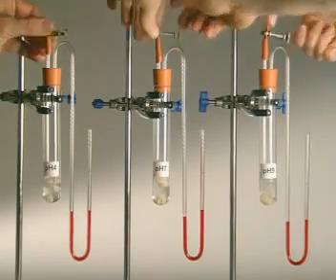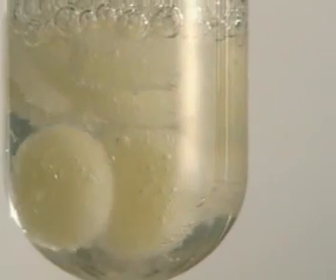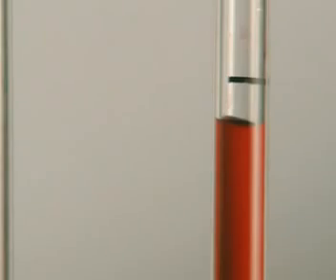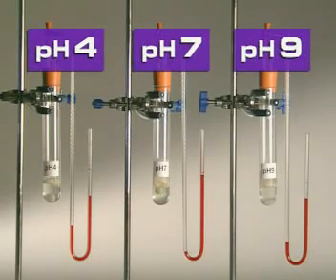The speed at which it rises is a measure of how quickly the catalase is breaking down the hydrogen peroxide. The time it takes for the fluid to rise a set distance is recorded. At what pH does catalase work best?